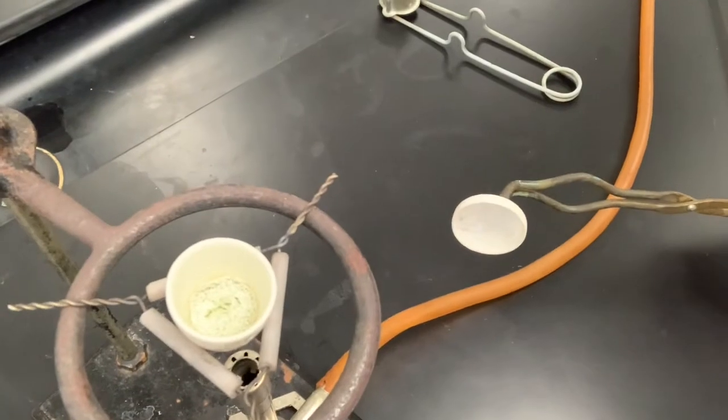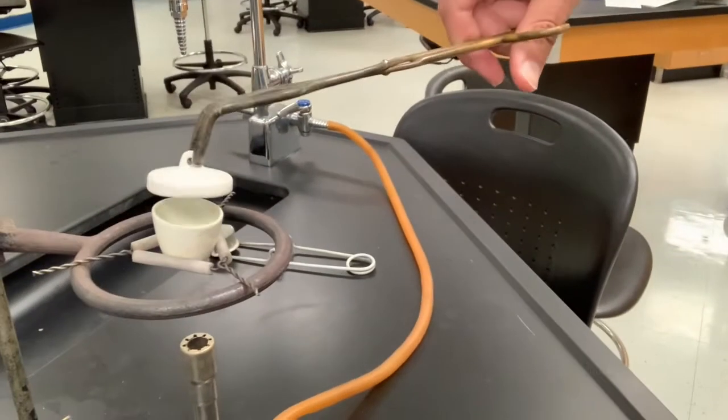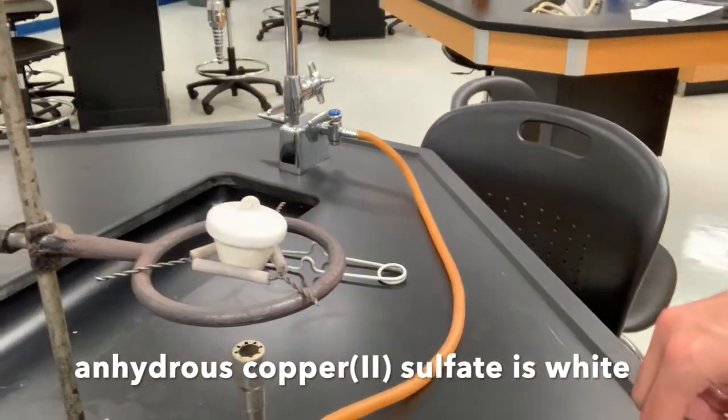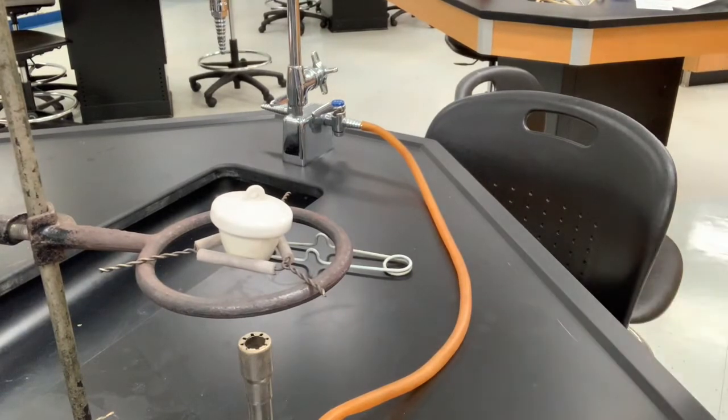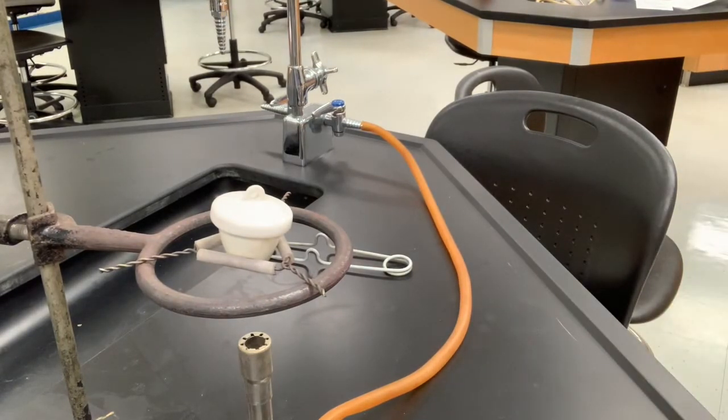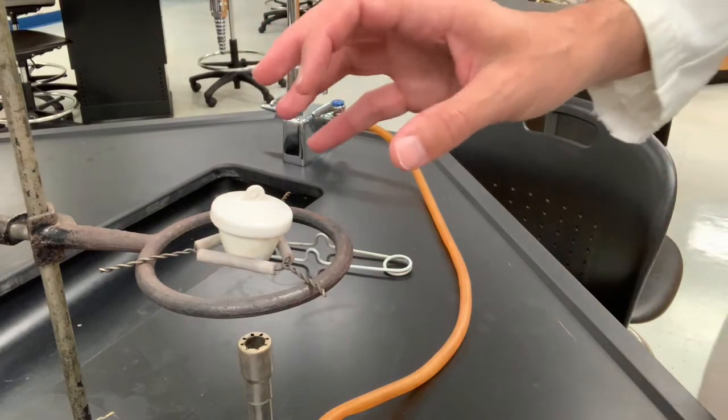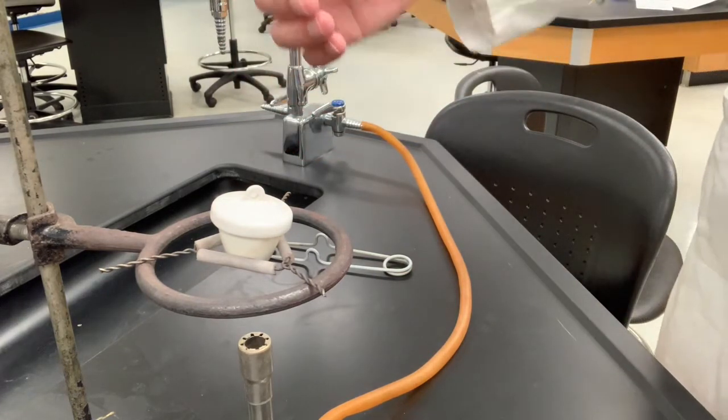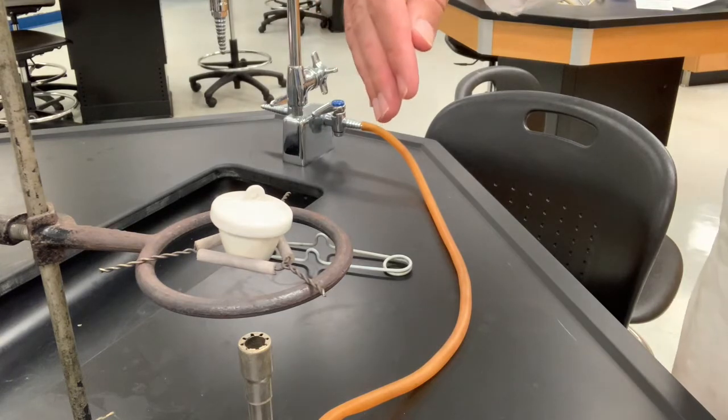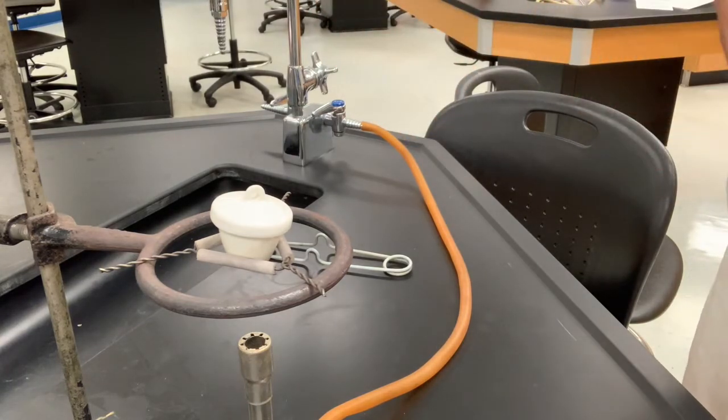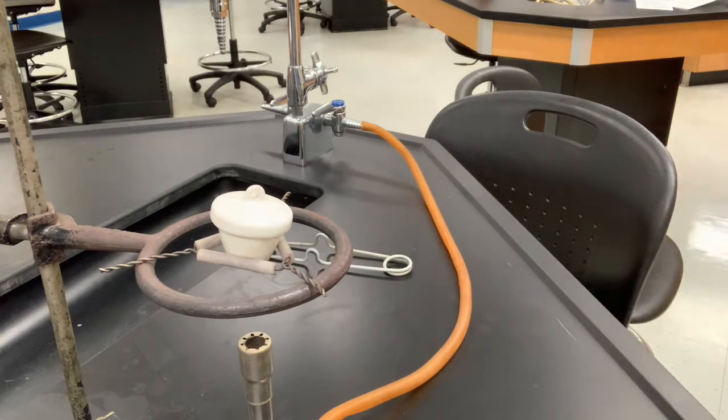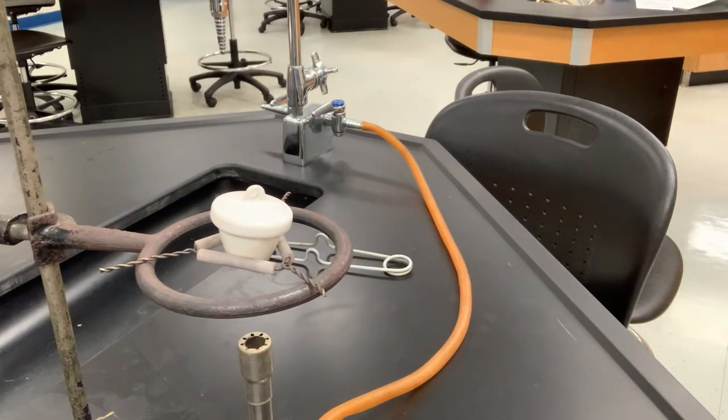It looks a little white now. In fact it might look a little pale yellow because of some sulfur that's possibly decomposing as I heat this too strongly. So I'll now cool this down. Again, we want to keep it covered because water from the atmosphere could absorb back into these crystals and give us a weight increase. So we want to cool it with the lid covered and I'll let that go 10 minutes and then I will come back.